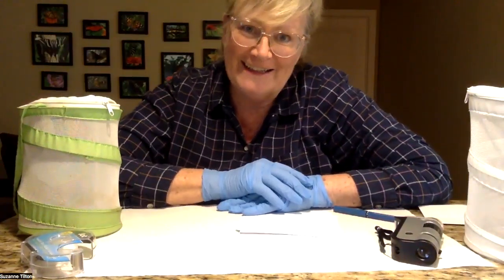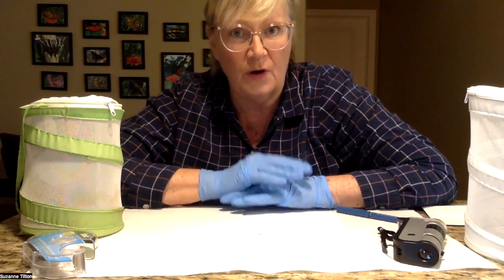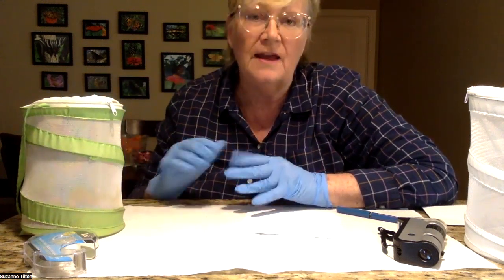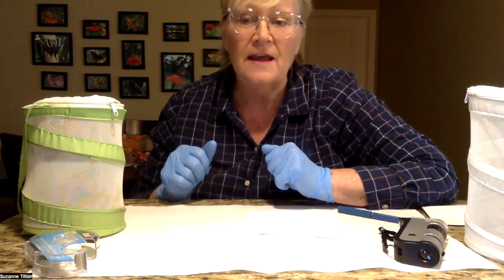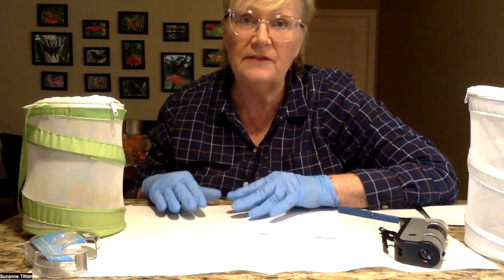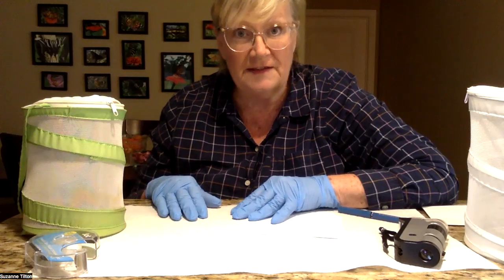Hi, this is Butterfly Lady, Suzanne Tilton, and I want to show you how I test Monarch Butterflies for OE. I have a few Monarch Butterflies that I raised. They were caterpillars that I gathered from the garden before there was a frost here in South Texas. Because I live in South Texas, I always test any of the butterflies that I raised because OE is very prolific in this area.